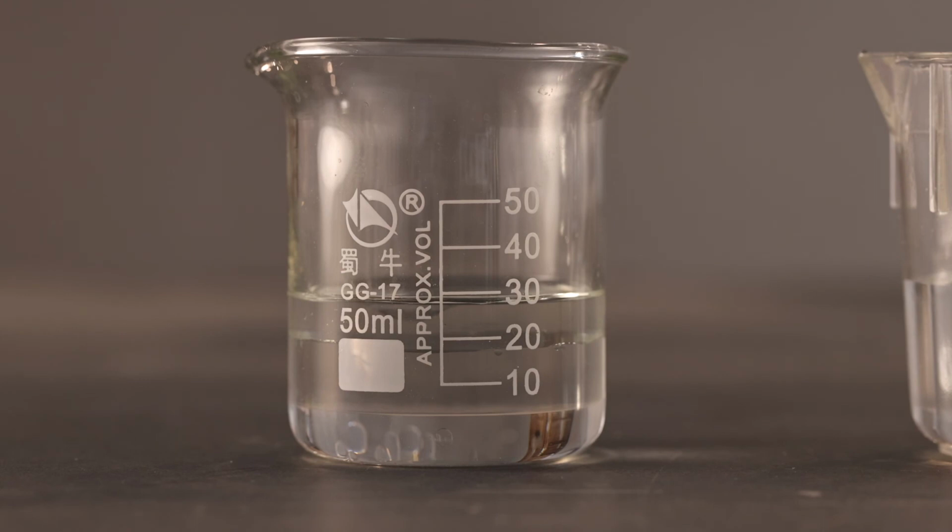Make sure you take a look at the sample you test from the vapor degreaser and look for any separation and use the proper sample retrieval we discussed to get the most accurate results.